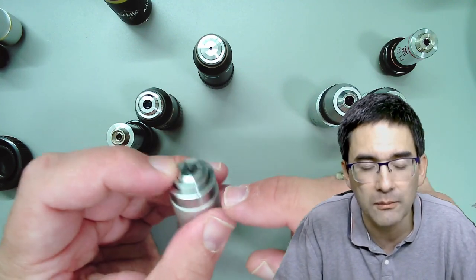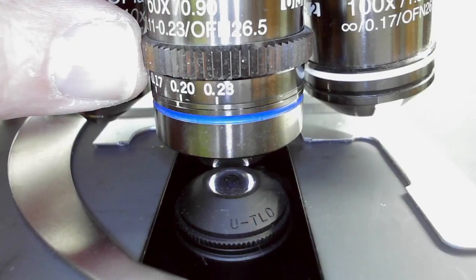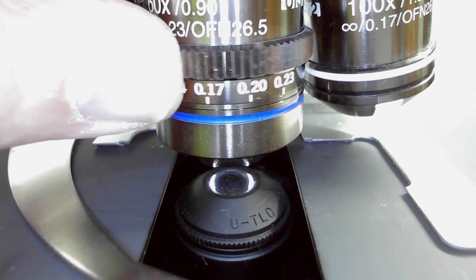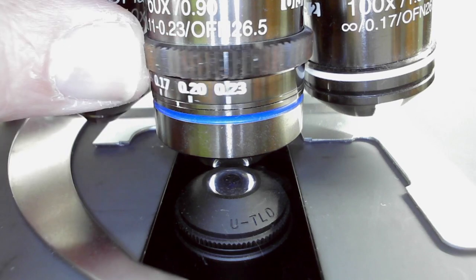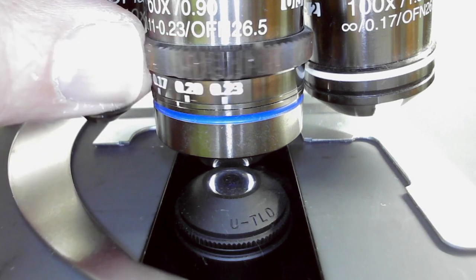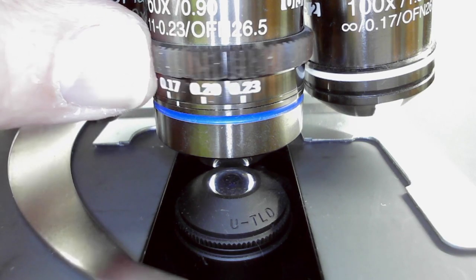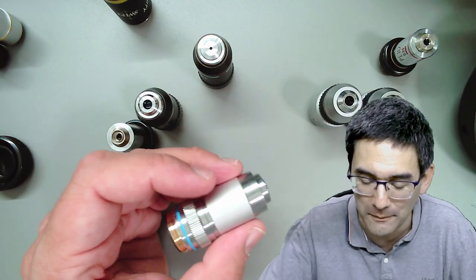Last but not least, here's a 60x objective with a so-called correction collar. A correction collar allows you to adjust for the thickness of the cover glass. The standard is 0.17mm, but some cover glasses are a little bit thicker or thinner, and you can adjust that, which improves the resolution. Needless to say, this feature drives up the price of the objective considerably.